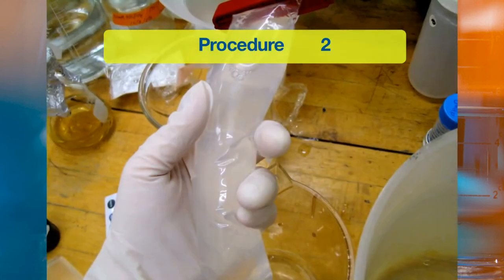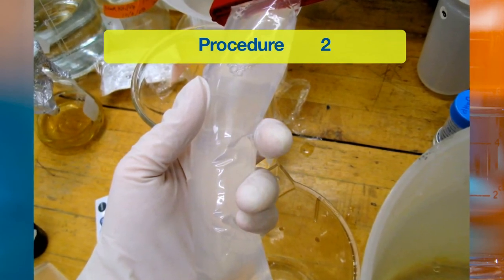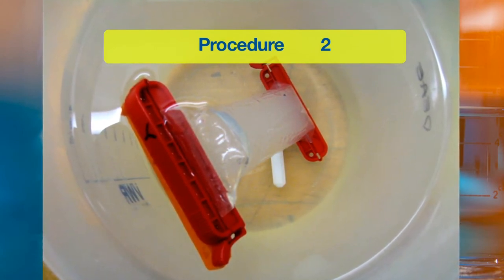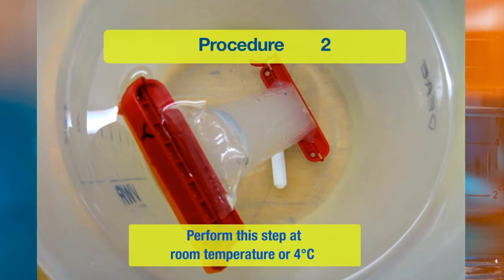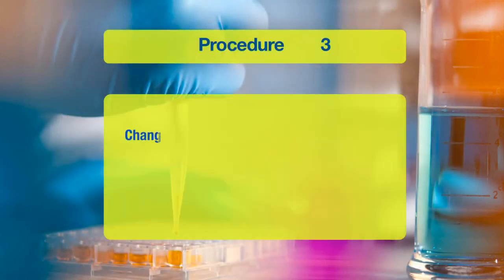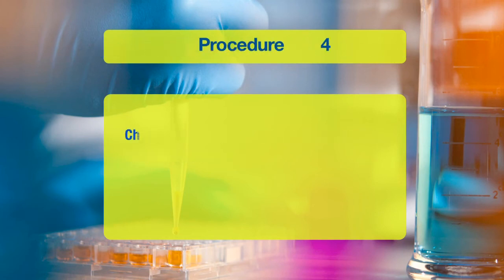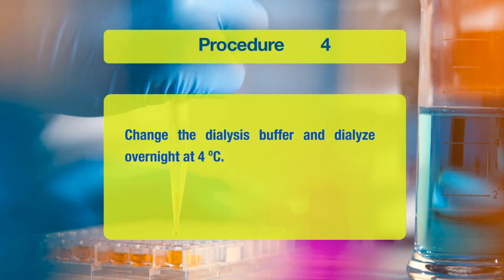Next, load the sample into the dialysis tubing and tie the ends with a cotton thread or use special clips for dialysis bags, followed by dialysis for 2 hours. You can perform this step at room temperature or at 4 degrees centigrade. In the next step, change the dialysis buffer and dialyze for another 2 hours. In the next step, you can change the dialysis buffer again and dialyze overnight at 4 degrees centigrade.